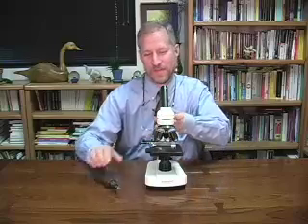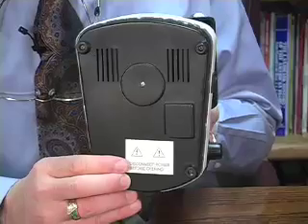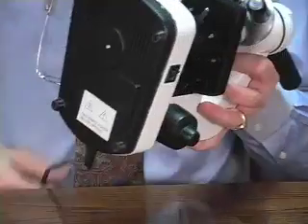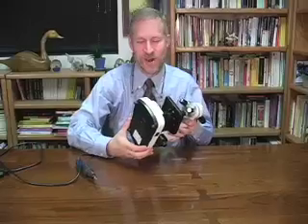That's all you need. I should point out on the bottom, by the way, it does say that you're supposed to unplug before you deal with any of the electrical parts that are inside. So I've made sure that my microscope is unplugged. Do that before you start.